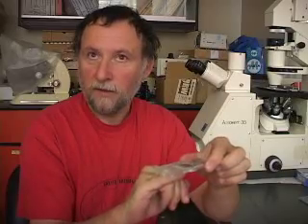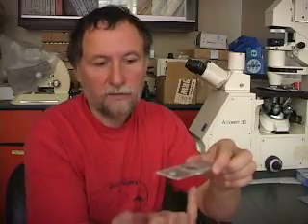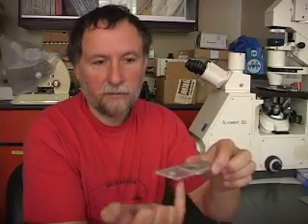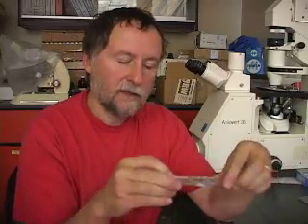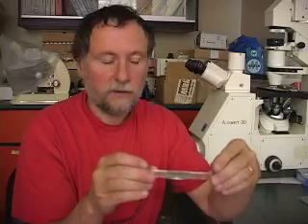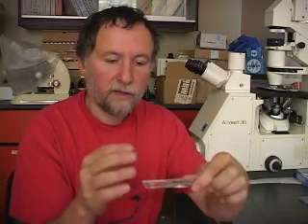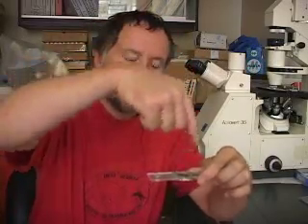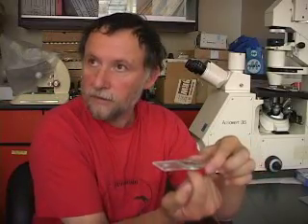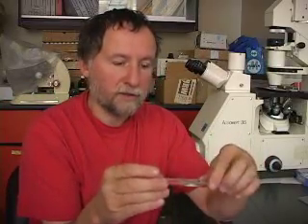These counting chambers have a very thin coverslip glass at the bottom, so you can have a microscope that is actually looking through the bottom and scan the entire bottom part of the counting chamber. That means the lenses are not coming from the top but from the bottom to look through this bottom section — and that is what we call an inverted microscope.